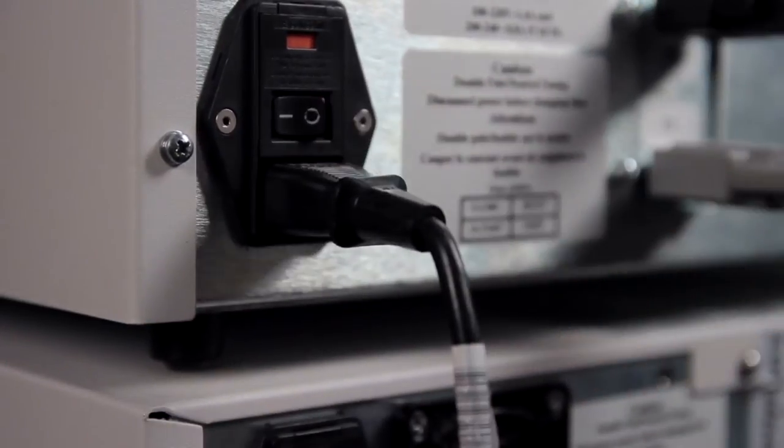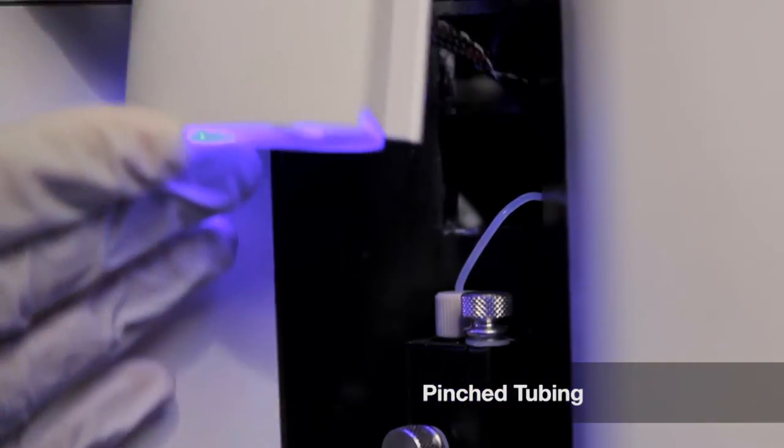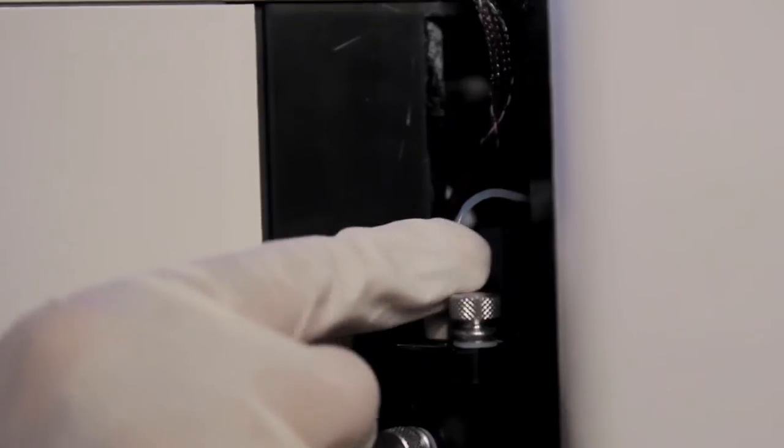One of the most common causes of this error is pinched tubing above the needle. The tubing being pinched can occur during routine maintenance when the light housing in the array reader is being replaced following a needle cleaning or change.